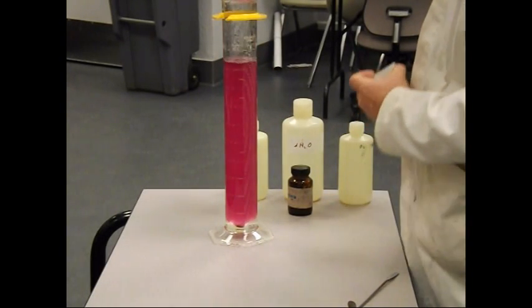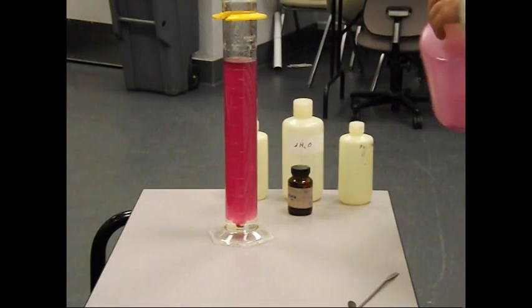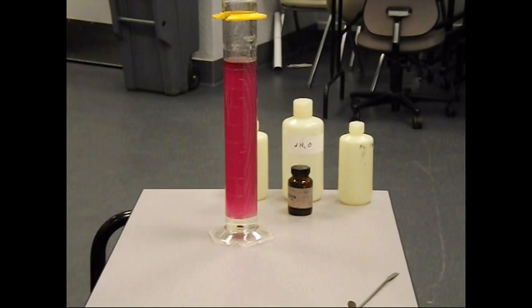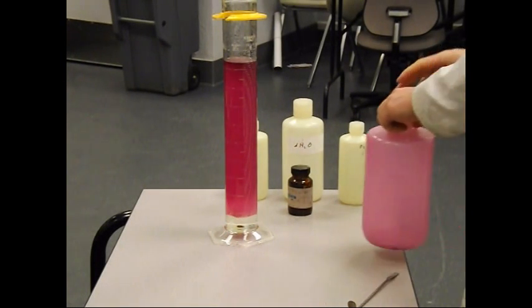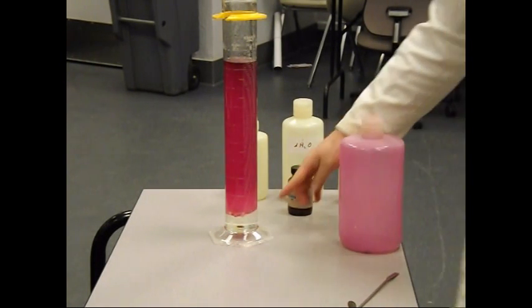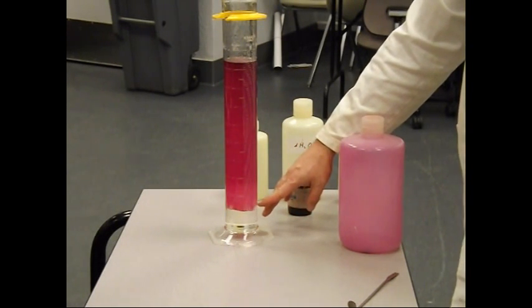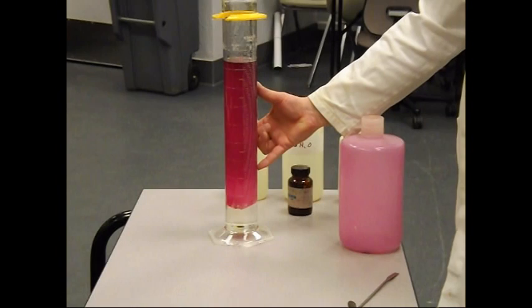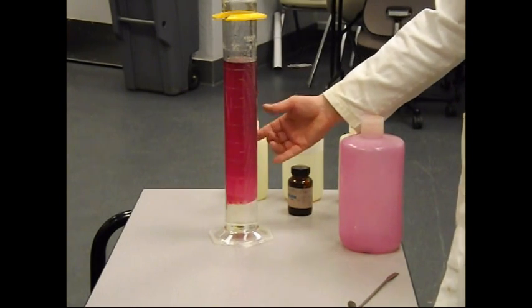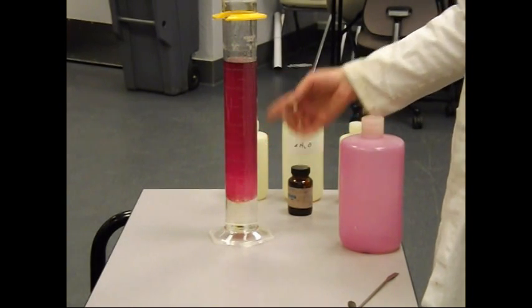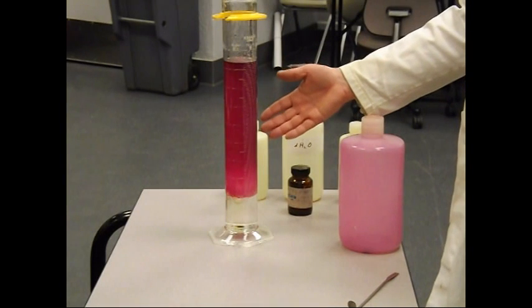And the entire thing is pink from the dissolved iodine. Where is it? You can see down at the bottom that the water layer is reforming. What we have up here—hexane and dichloromethane are miscible. They will dissolve in each other. They will mix together without a problem.